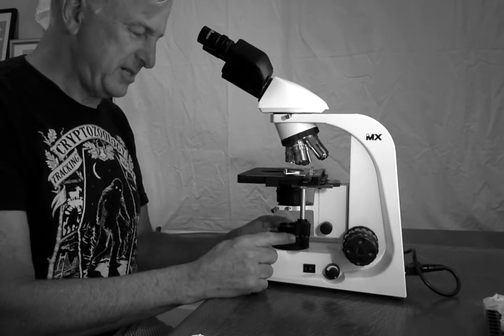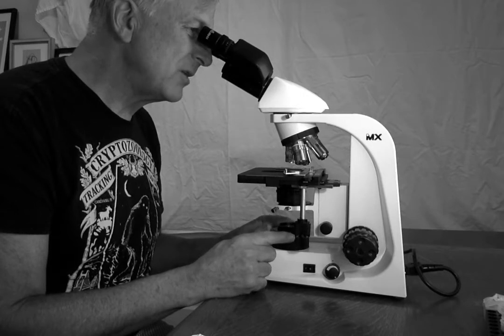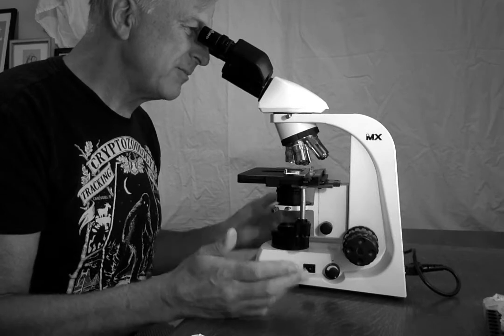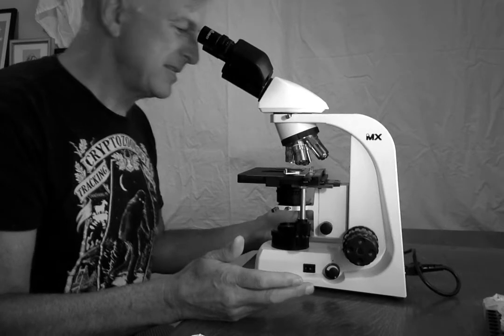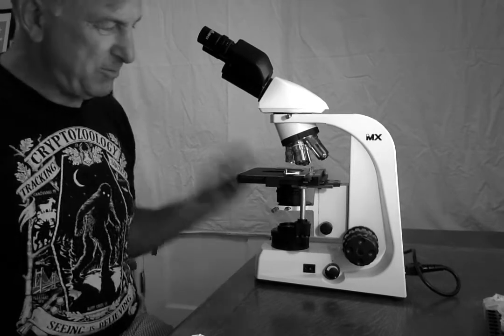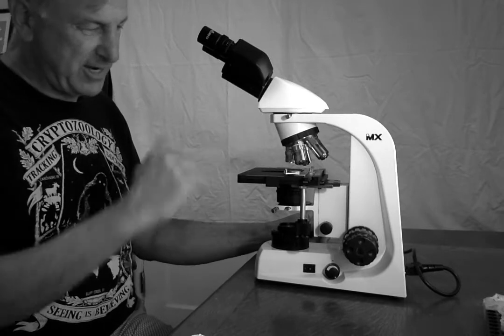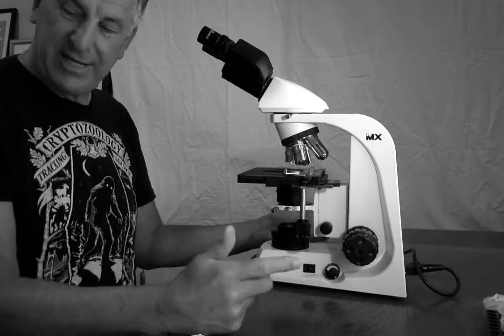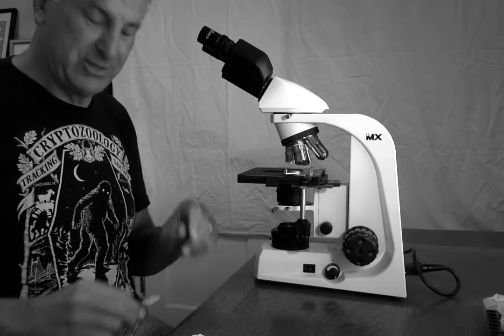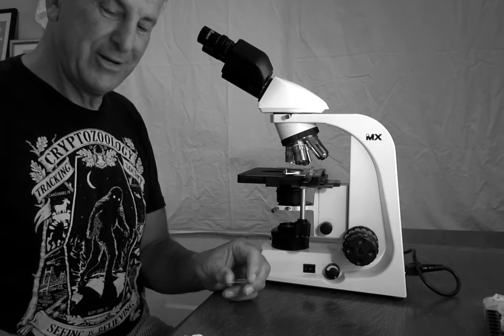I think I'm centered. I am now going to open the diaphragm a little more so that black boundary, that black edge, is gone, and my whole field of view is illuminated. And I have Köhlered my scope for the low-powered objective. As I work through higher powered objectives, I would go through these steps for Köhlering each time, and you'll make little micro adjustments to improve things. But I'm going to say I am ready to go.